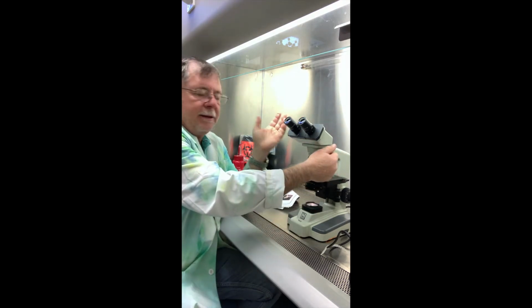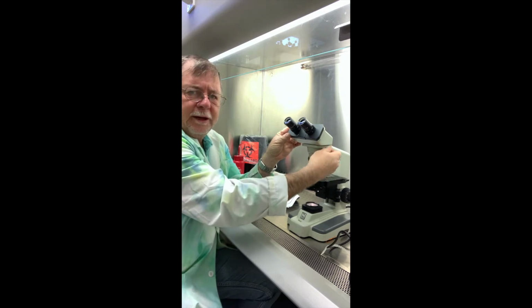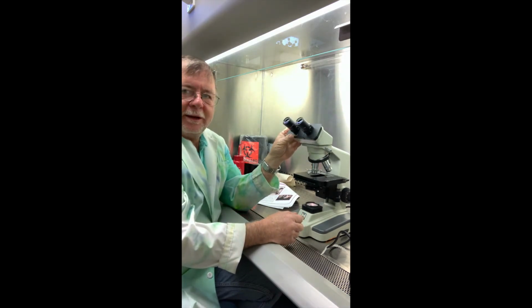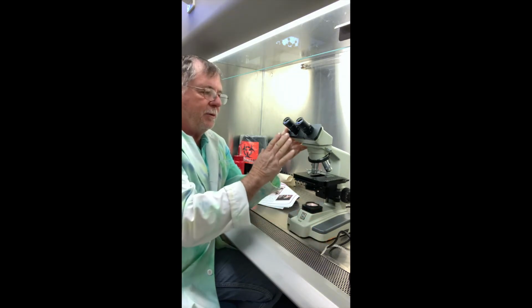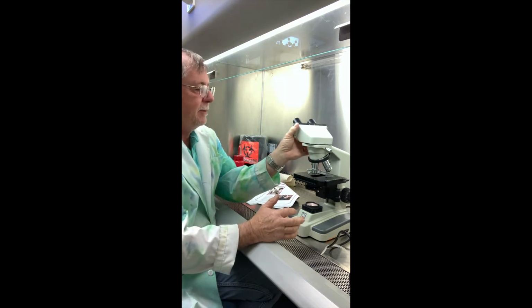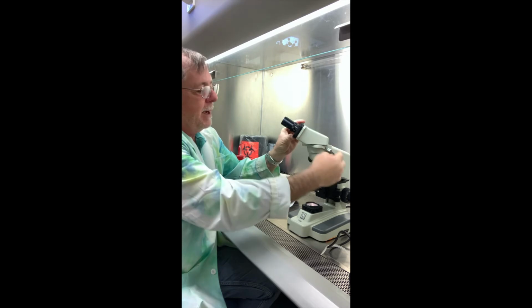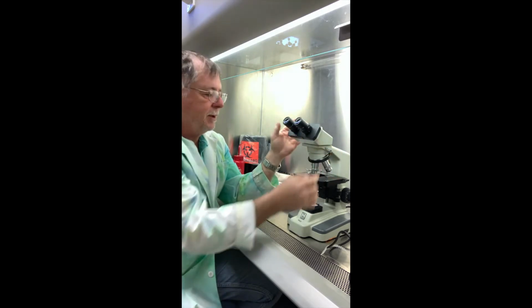There is a knob right here that we can twist and it unlocks, and then we can rotate the oculars. If we're in class and I'm helping you out, and you say, well, I can't find this, or, oh, this looks pretty neat, would you look at it? I generally won't come around and look into the eyepieces here. I will be on the other side of your desk, and so I'll loosen that up and spin it around and look at it this way. Okay, and then put it back, but just make sure that you lightly tighten this when you're done.